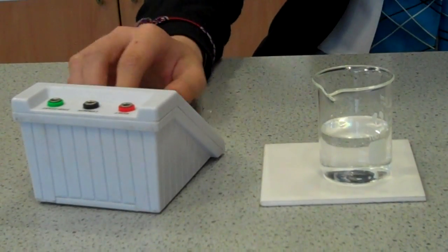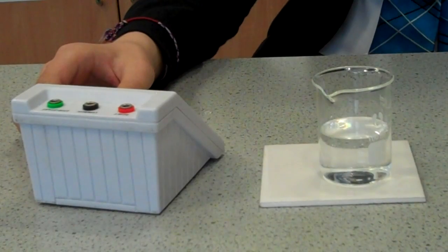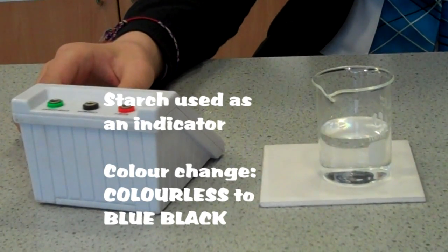We are adding hydrogen peroxide to the beaker. We are using a timer to time the color change.